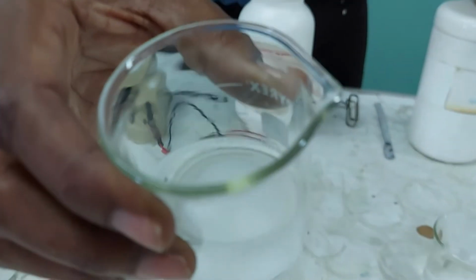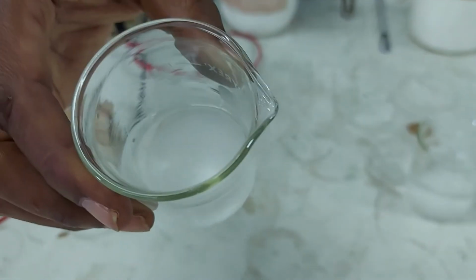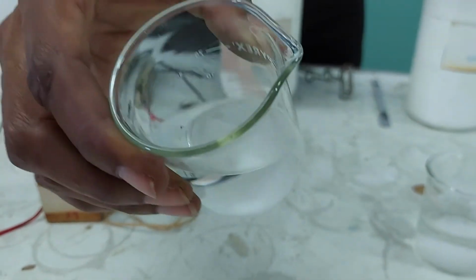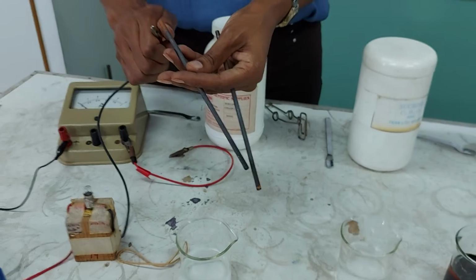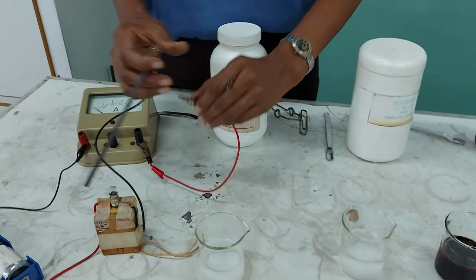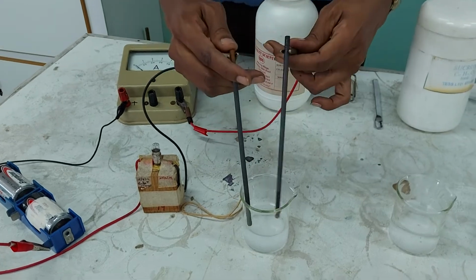This is what happens when sodium chloride is dissolved in ethanol. Are you seeing anything at the bottom there? Tell me if you're getting anything going on there, all right? Wow, look at that. And that was stirred quite a lot. Let's see, is this going to conduct electricity? Let's see. I rinsed my electrodes.